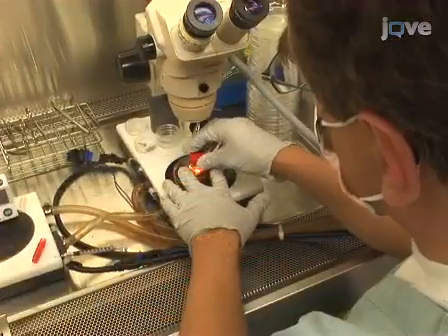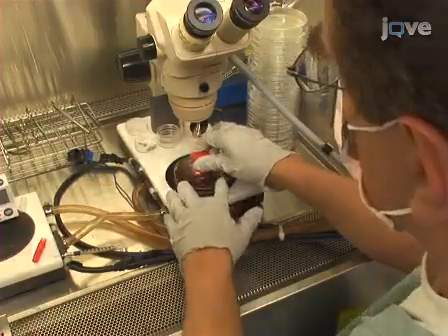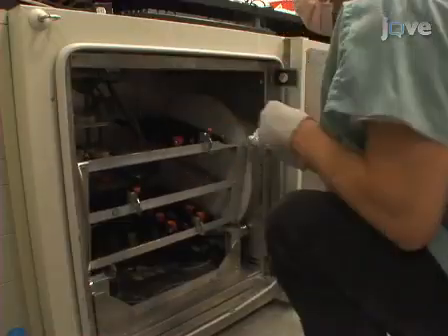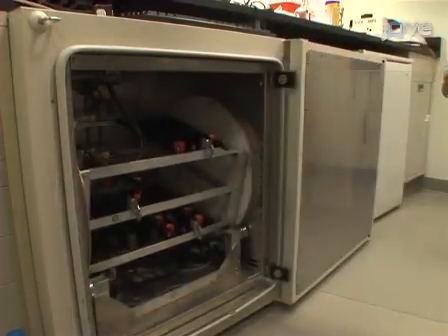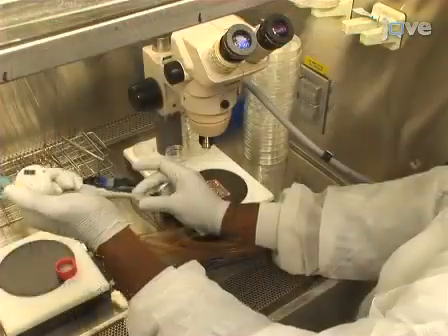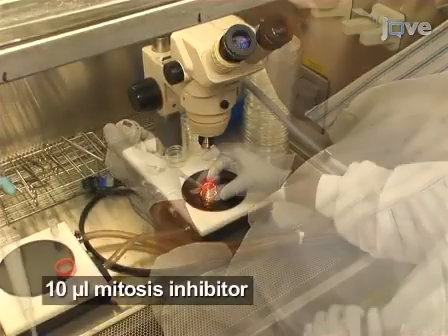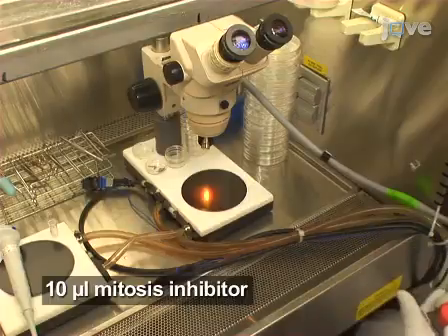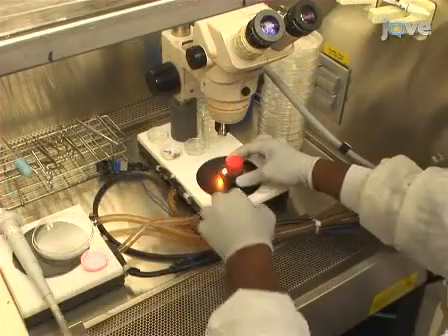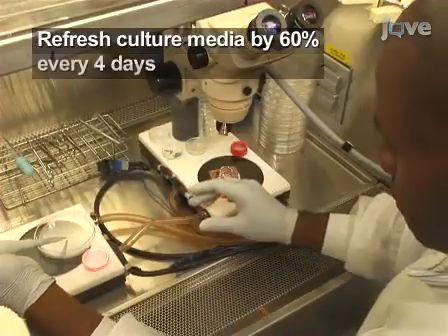Then, tightly close the MEA chamber and place the MEA culture assembly onto the rocking storage tray inside the incubator. After 2 days in vitro, add 10 microliters of mitosis inhibitor. Then, refresh the culture media by 60% at 4 days in vitro and every 4 days thereafter.